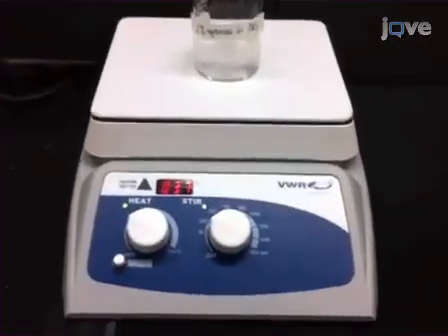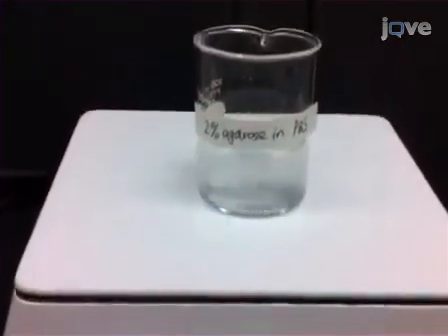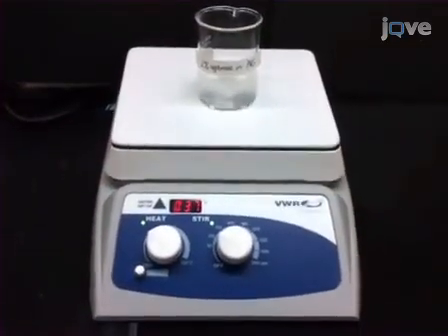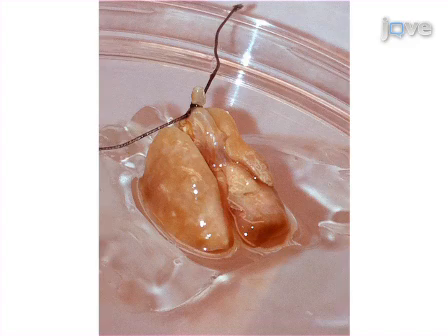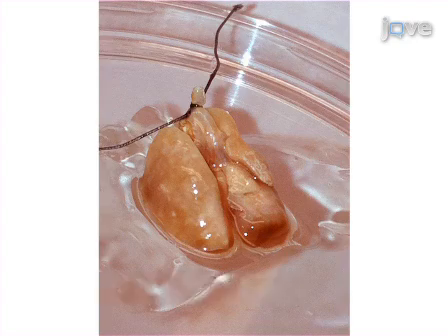To prepare strips of lung tissue, begin by stabilizing the lung structure for cutting by inflating isolated mouse lungs intratracheally with 50 milliliters per kilogram body weight of warm 2% low gel point agarose prepared in PBS. Tie off the trachea and cool the inflated lungs in a bath of PBS at 4 degrees Celsius for 60 minutes. The agarose will gel and stiffen in the air spaces to gently stabilize the lung structure during this interval.